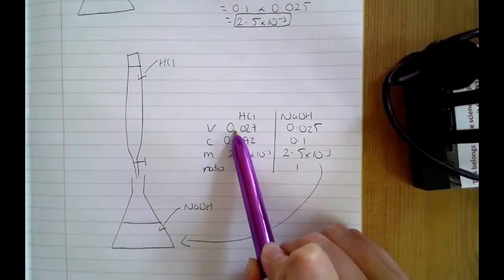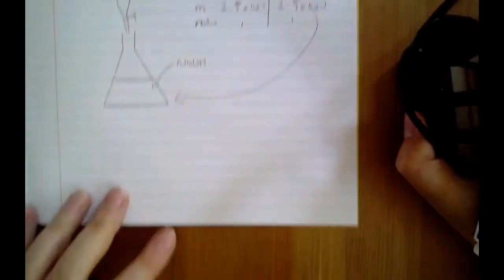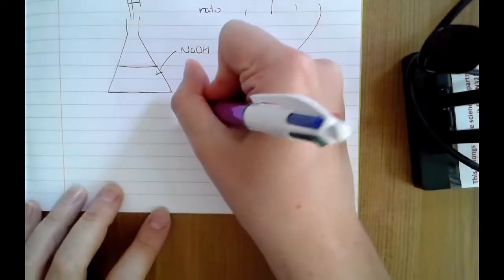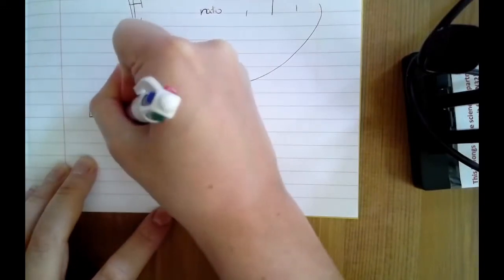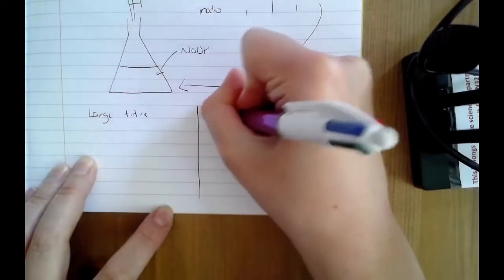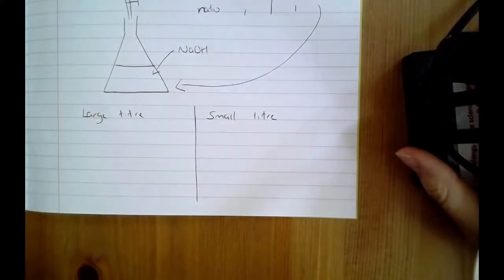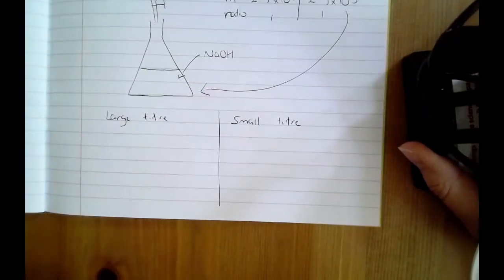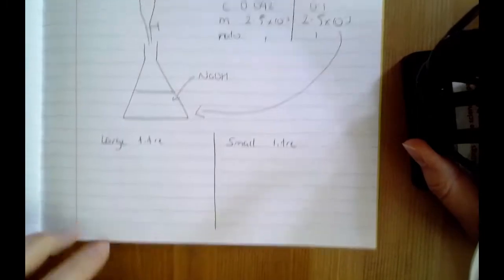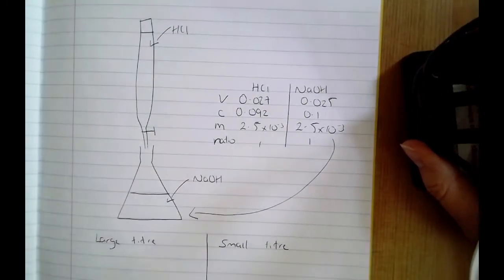So again, you're going to do this a couple of times and you're going to get the average, but whatever you're adding from the burette, that's your titre. And they can ask you questions about, sometimes the titre is too large, and sometimes the titre is too small, or smaller than expected, or smaller than everyone else in the group who did it. And they can ask you to suggest reasons why. So the first thing we're going to look at is reasons that would cause the titre to be too large. So by that I mean you've added more from the burette than everyone else has, okay?